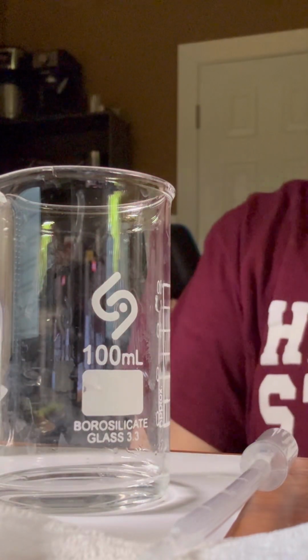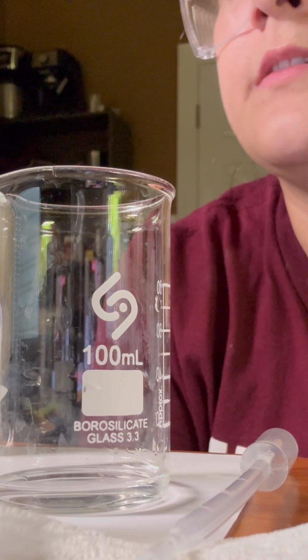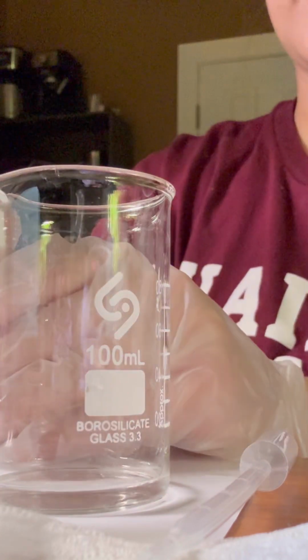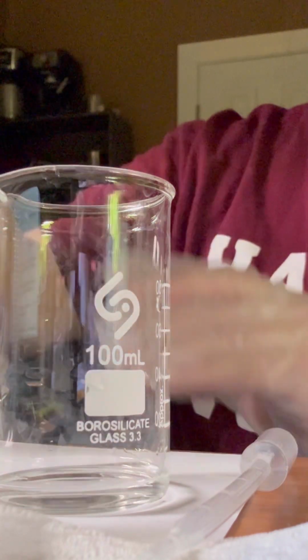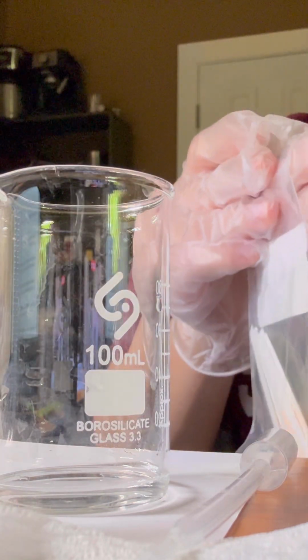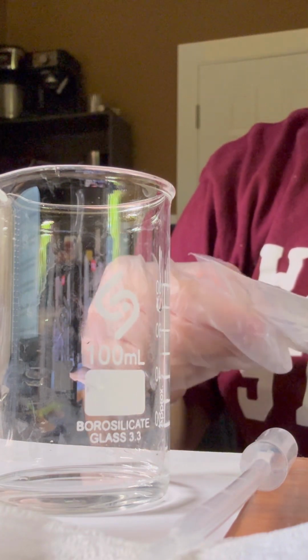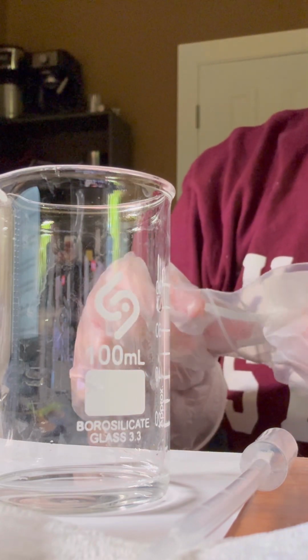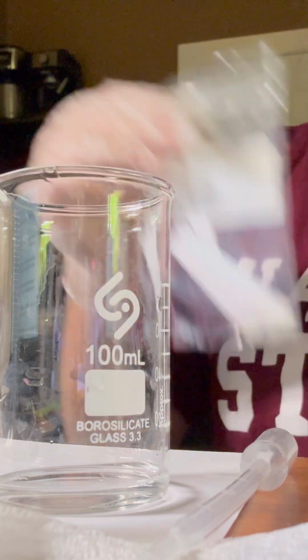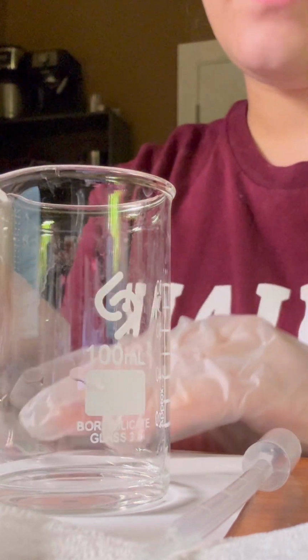And it says gather a pH strip from the kit and place it into the solution, and we'll determine the pH of the solution with 10 drops of sodium hydroxide. So let me cover this up. Alright, and then we gather from a pH indicator. And we'll determine the pH with 10 drops of sodium hydroxide. Alright, so here we go.